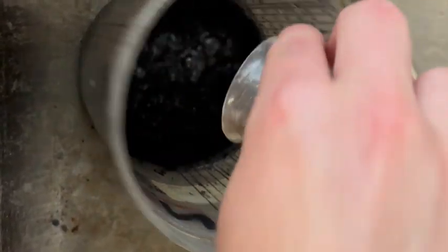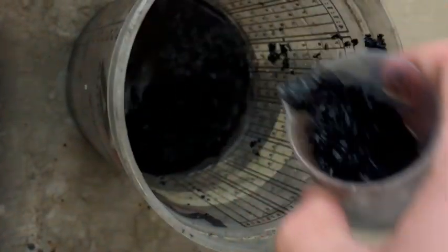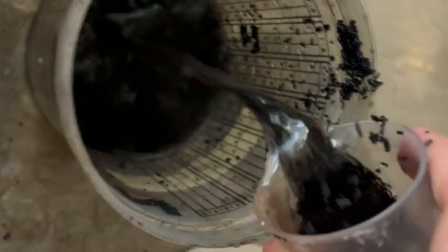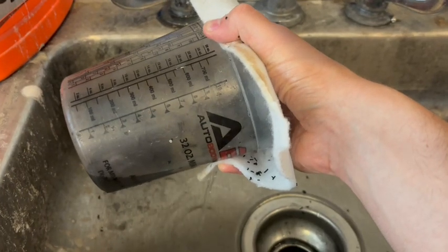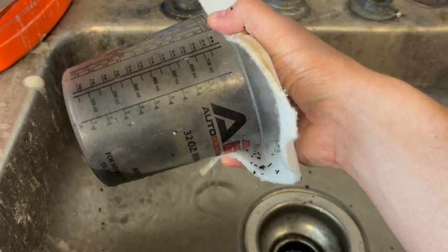Now, one downside to GAC is that eventually the pores will clog and it needs to be either cleaned or replaced. So this is not really an industry method, but a method that the environmental design team does. We pretty much rinse out a GAC with water until it is clear. You can see that water is not clear, it is very black. But in industry, it's very common to just reapply heat treatment to the GAC and pretty much activate those pores again and get rid of all the contaminants within them.